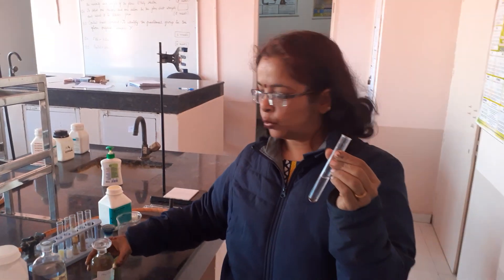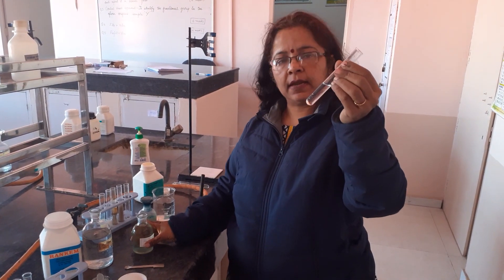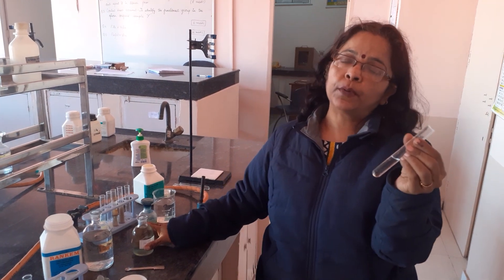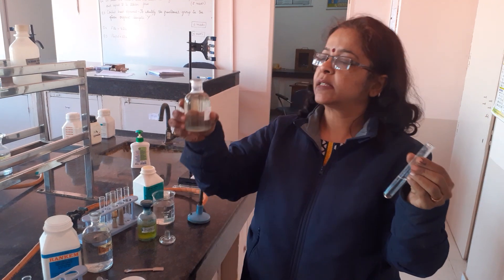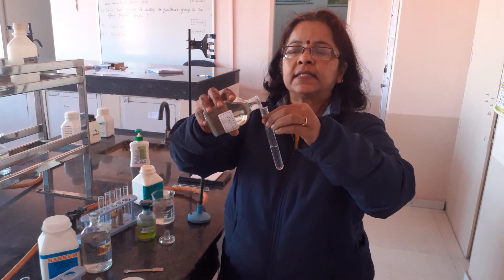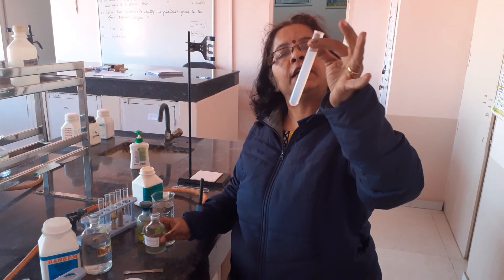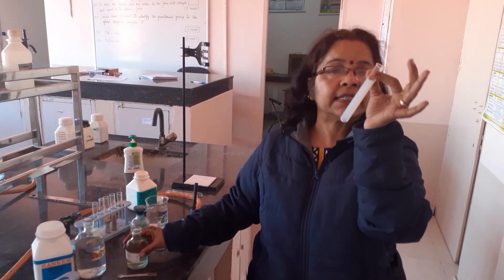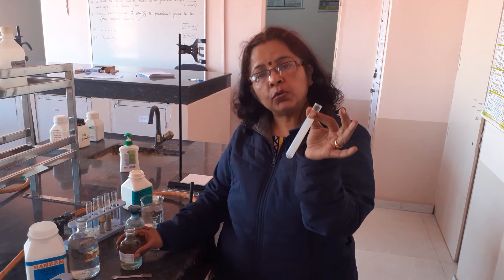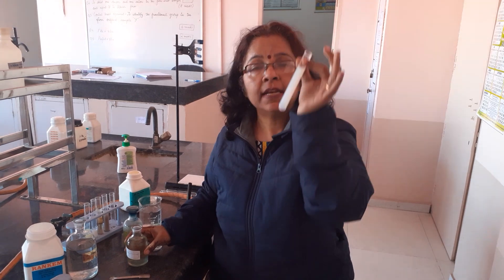Instead of H₂S, you can also use a sodium sulfide solution, but the observations would be different. So when you have a zinc salt with HCl and no lead in it, for the second group — although zinc is actually in the fourth group — since you are not using H₂S but using sodium sulfide, you would get a white PPT right here. This white PPT is zinc sulfide, and it is an indication that the ion is zinc.